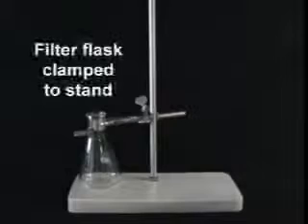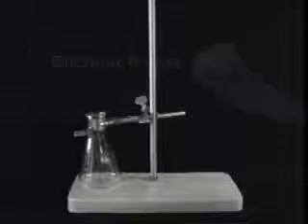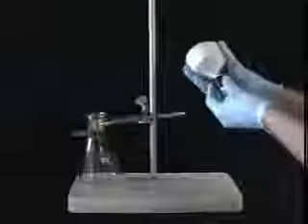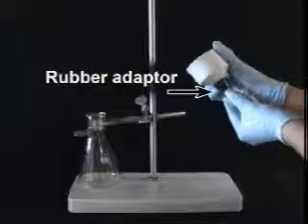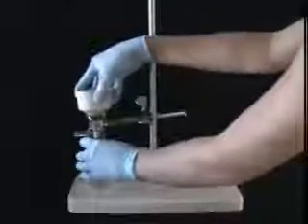Now for the setup. Here we have our filter flask. Notice its characteristic sidearm. Make sure the flask is clamped firmly to a stand. When it's all put together, the filter and funnel will make a top-heavy structure, making it prone to fall. So a clamp is your best bet. And here is our Buchner funnel. If it doesn't already have a rubber adapter, add one. Securely fit the funnel and adapter into the top part of the flask.